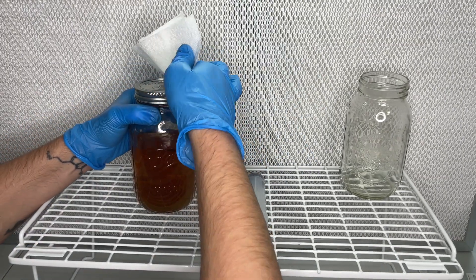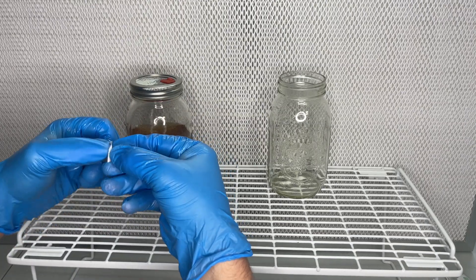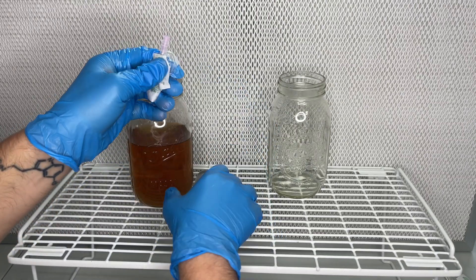So because of that, I have started using a 60ml sterilized syringe to remove around 200ml of the excess liquid.